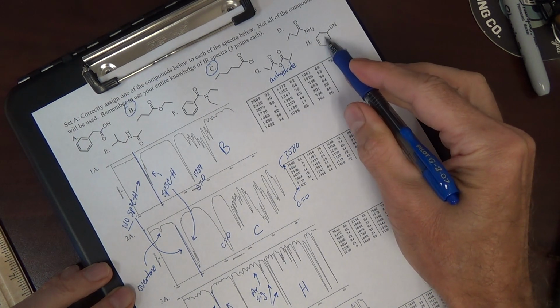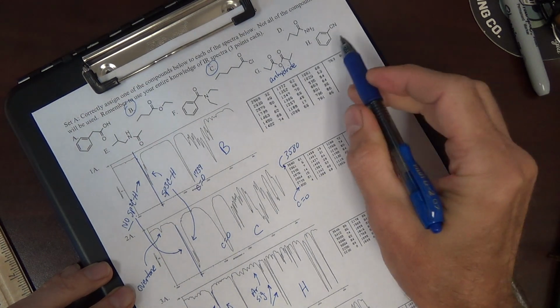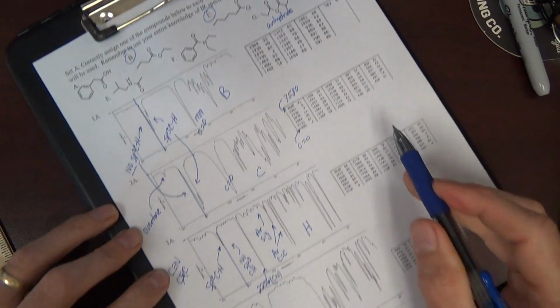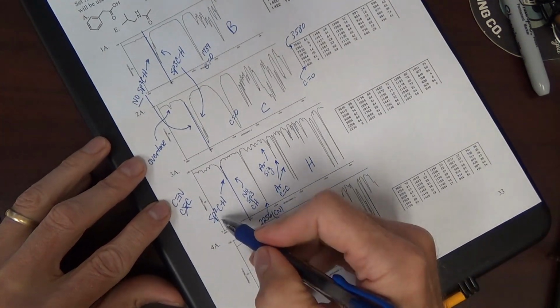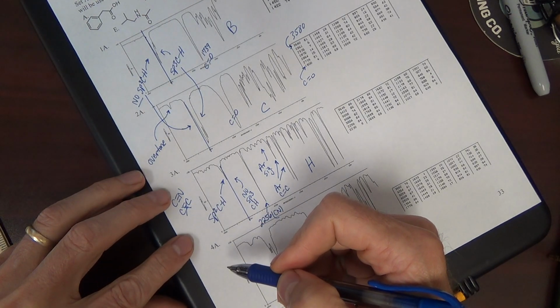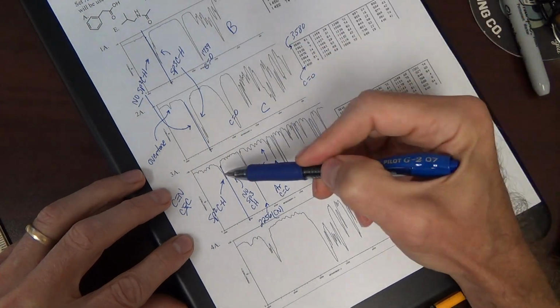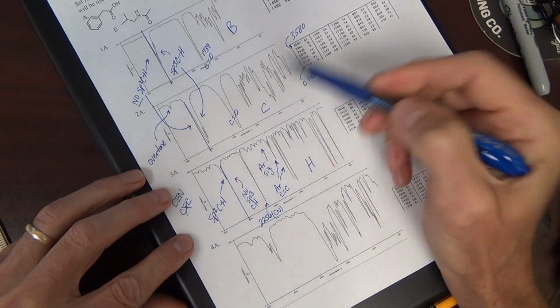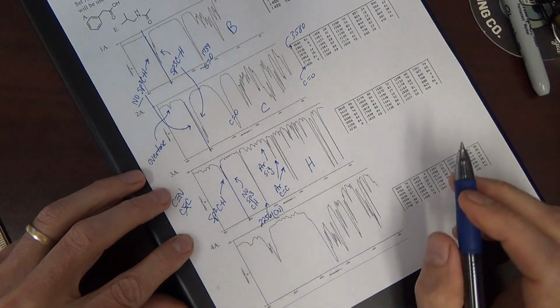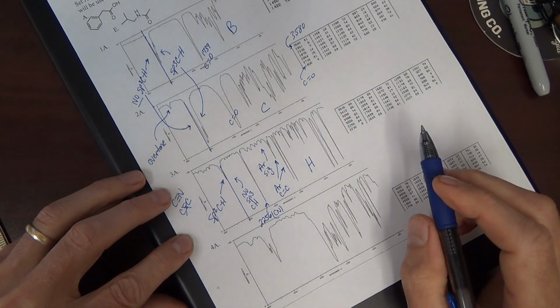Cyano group, aromatic signature. And of course, there are sp2 CH bonds here. There's 5 of them. Each of the other carbons has an H, and so there are many sp2 CH's. Of course, just because there are 5 of them does not mean we're going to get 5 peaks. You can't really quantify with your CH peaks like that.